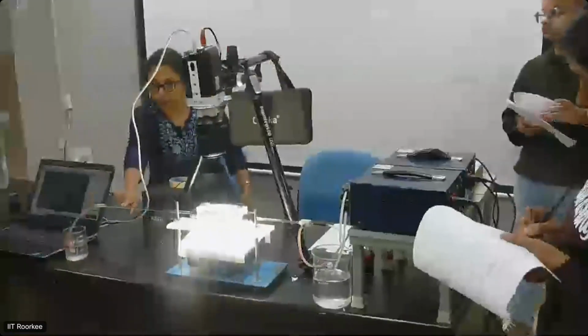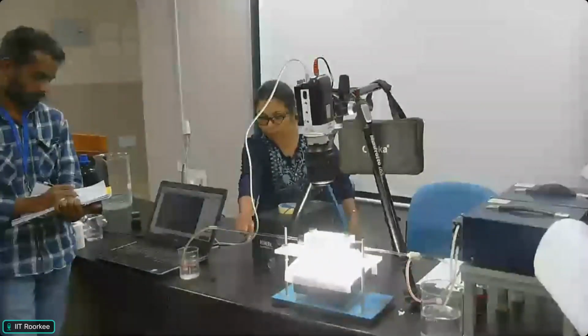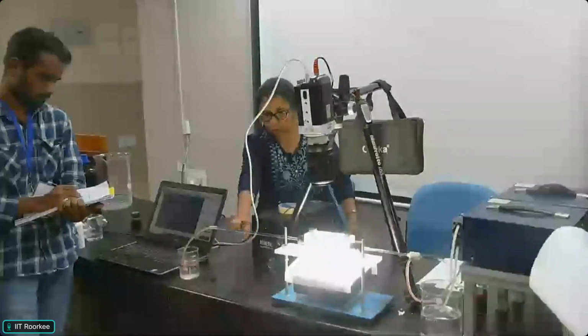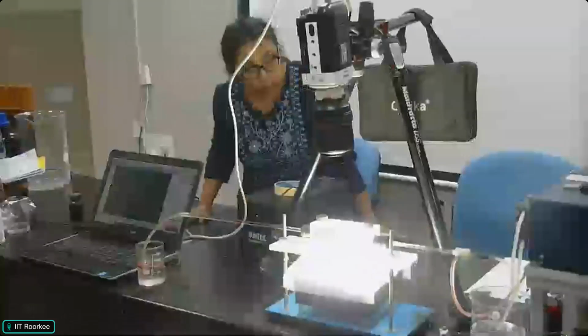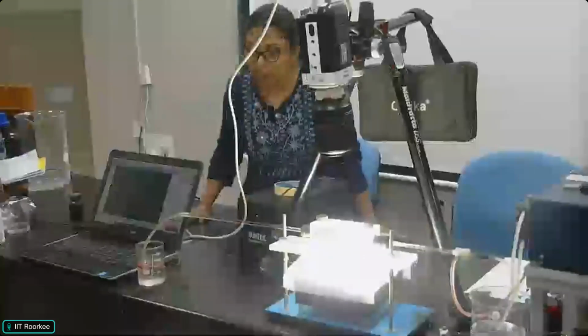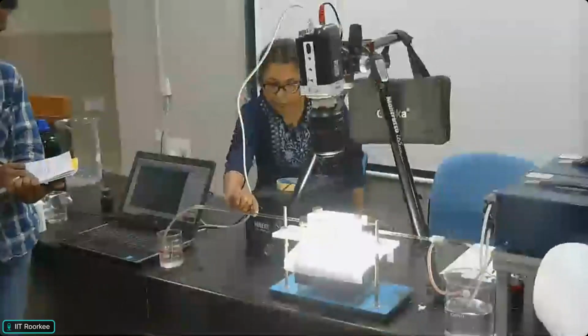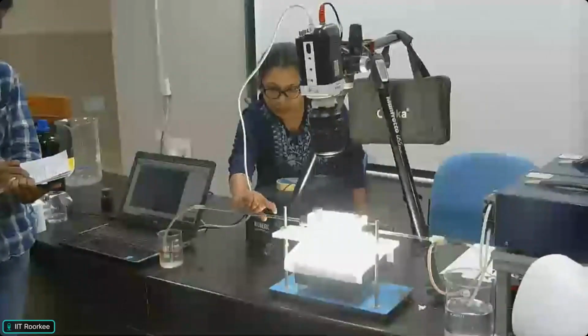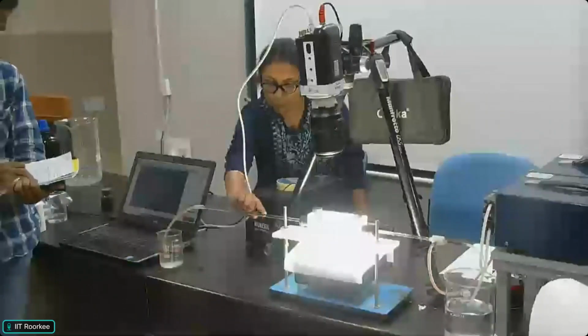So what you are visualizing over here is different flow patterns. The continuous phase over here is water, and you can see the flux of toluene. Now the flow rate of toluene is maintained at 2 ml per hour, right? And I guess all of you have noted down the slug. You can see the slugs, there are small, tiny slugs, and in between, you can see very small drops. You can see the spherical drops also traveling.